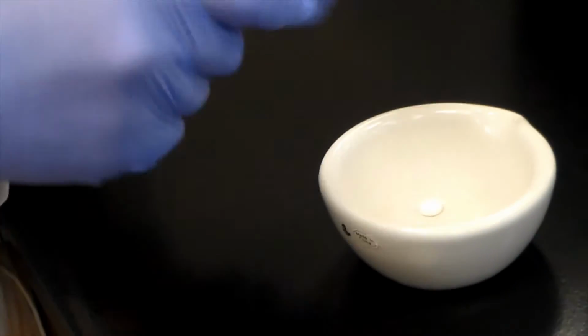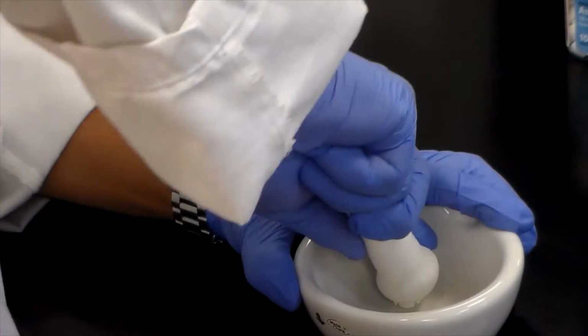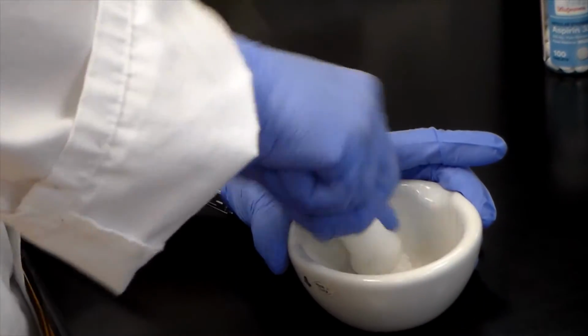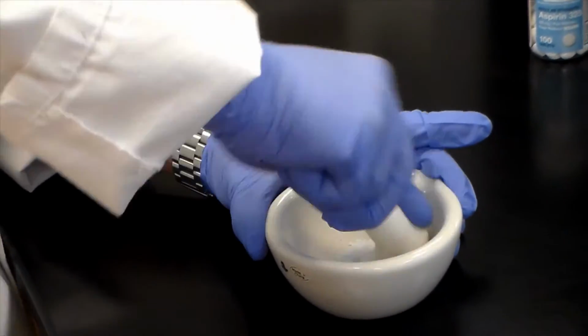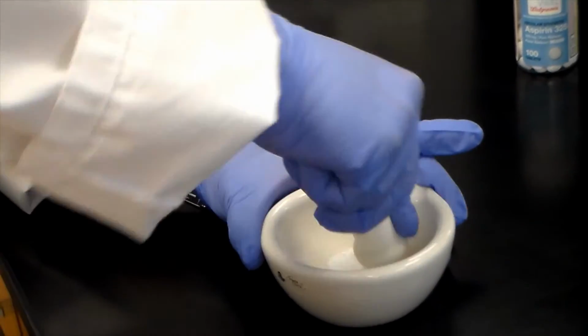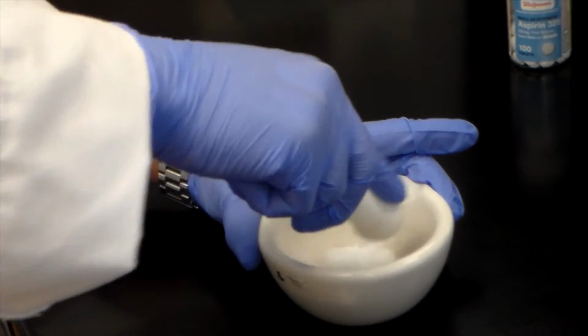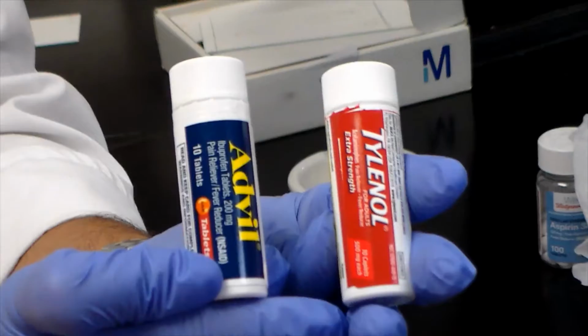Read or review Operation 19 carefully before you begin. Obtain a quarter tablet of the unknown analgesic drug and grind it to a powder with a flat bottom stirring rod or spatula blade. If the tablet is coated, remove as much of the coating as you can before grinding.